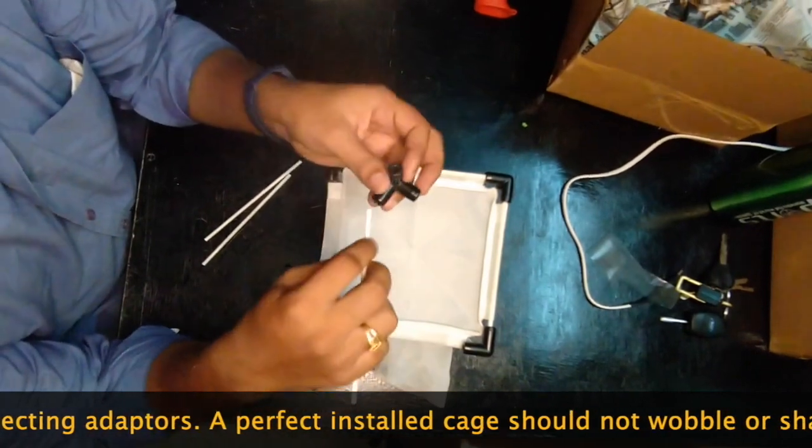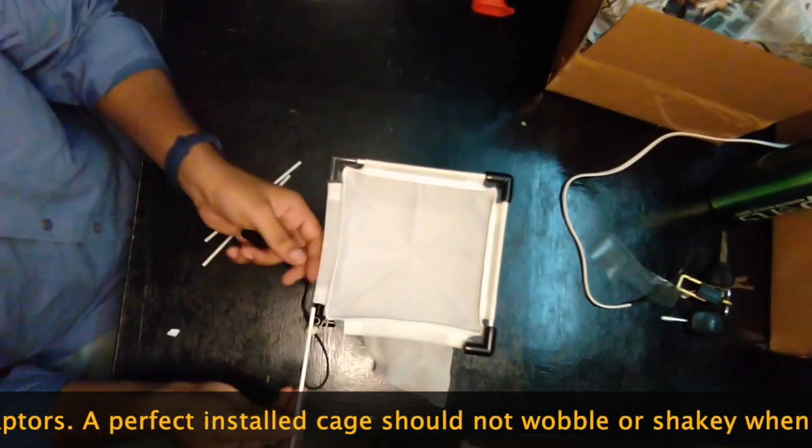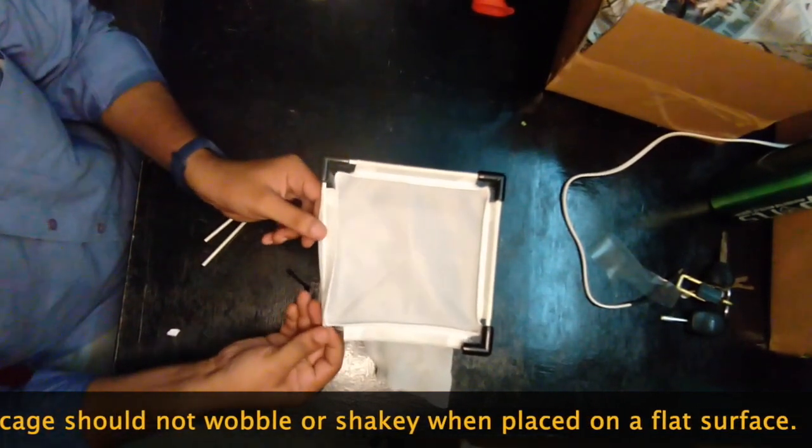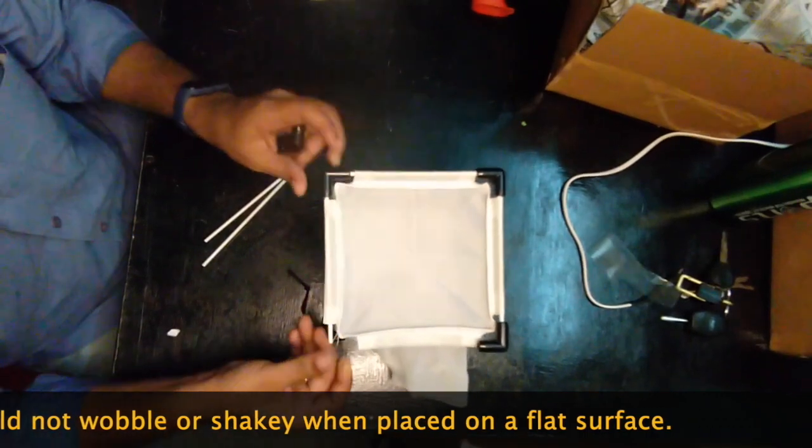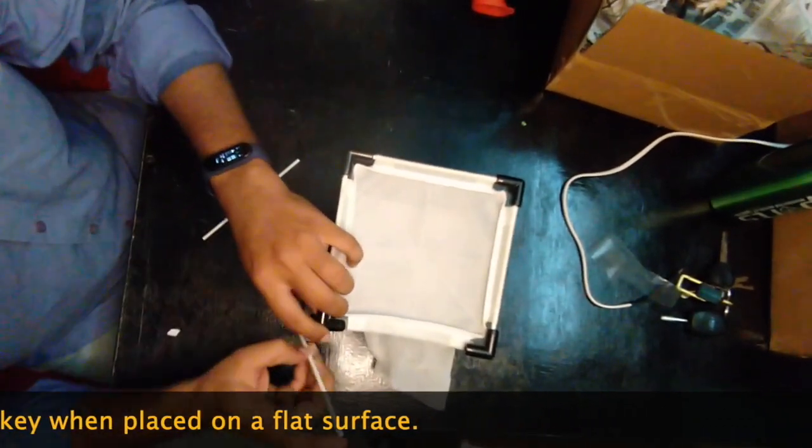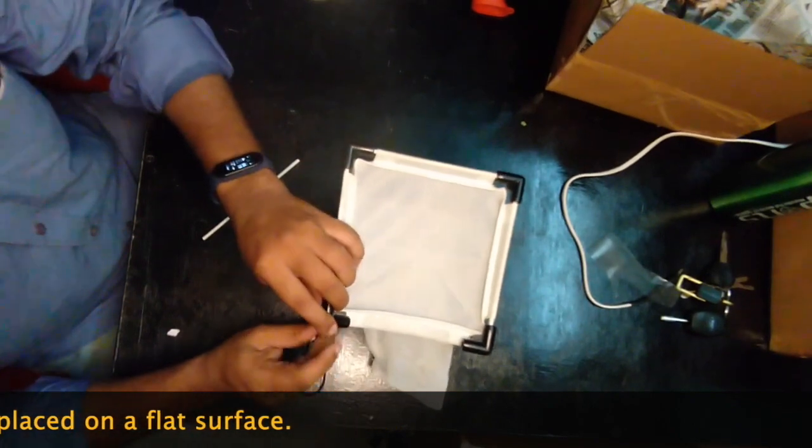The new cages need to insert the spoke into the sleeve side, and then delicately press into the aperture provided there, and then do the side installations similarly.